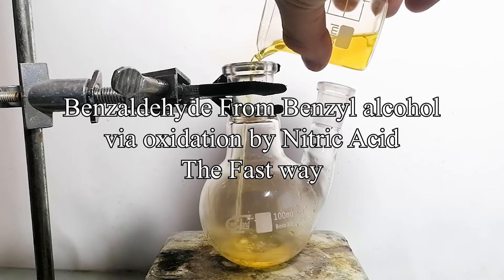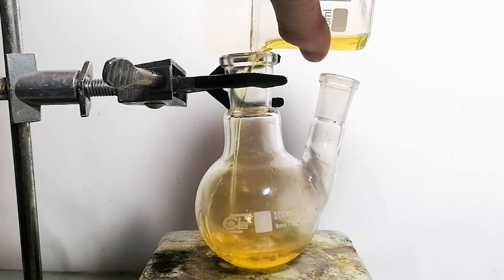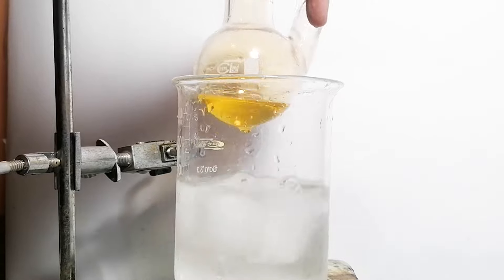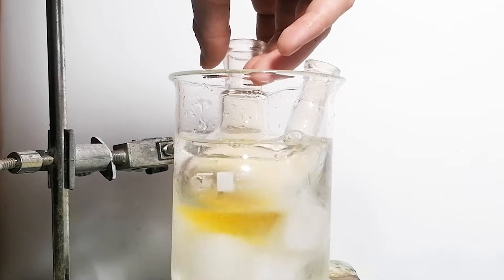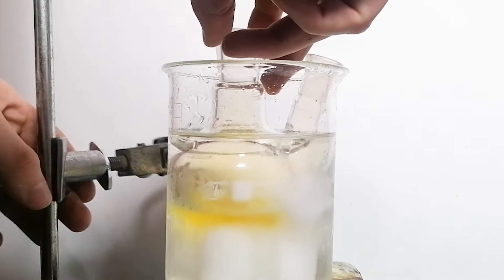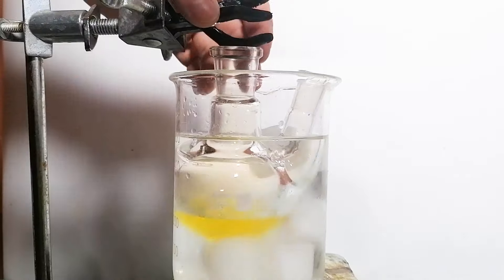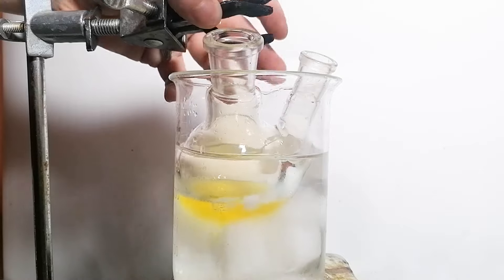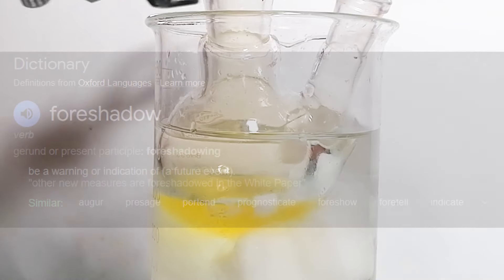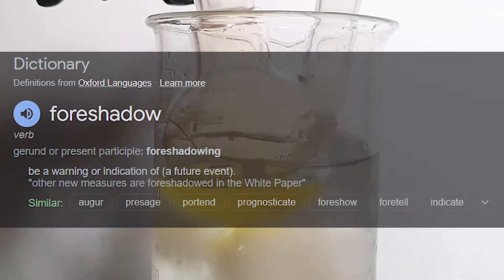First, to a two-necked boiling flask was added 50ml of fuming nitric acid, after which it was put into an ice bath. What's left to do is wait for it to cool down to like 3°C. Now let's pipette some benzyl alcohol into it, but just a small amount so that nothing totally unexpected happens.